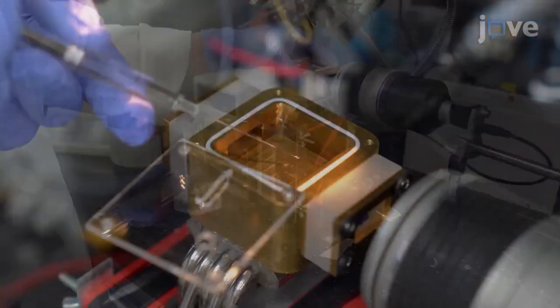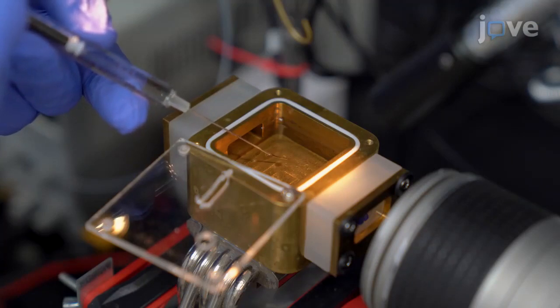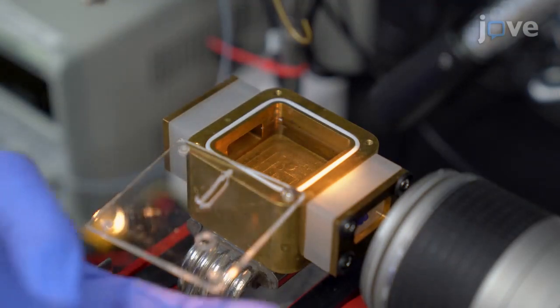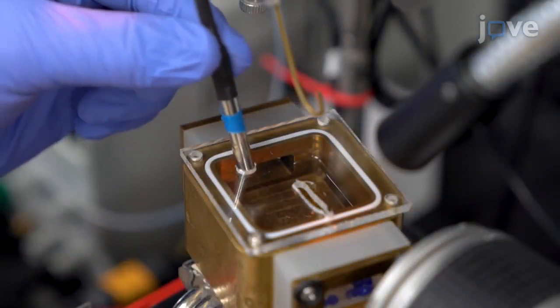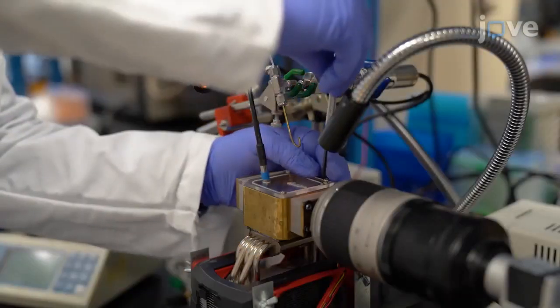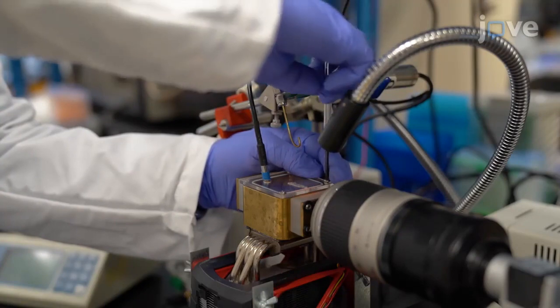Using the syringe, insert a droplet of deionized water at the bottom of the hydrate visualization cell. This water droplet is the seed hydrate. Then, place the temperature sensor inside the hydrate visualization cell close to the bottom of the cell. To prevent evaporation of the cyclopentane, put the acrylic cover on the cell and screw the cover in place.